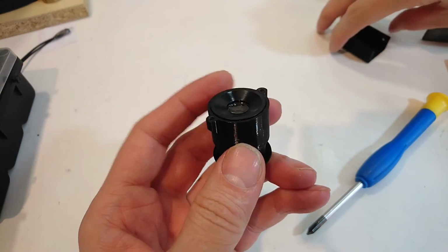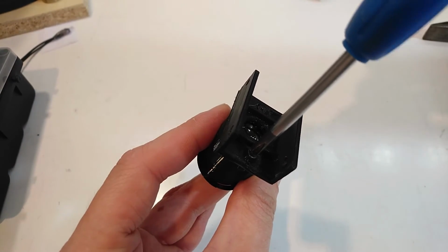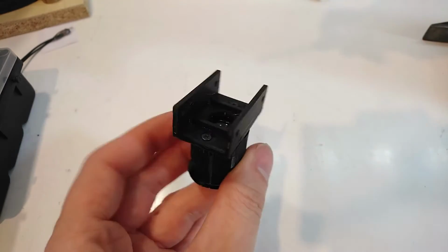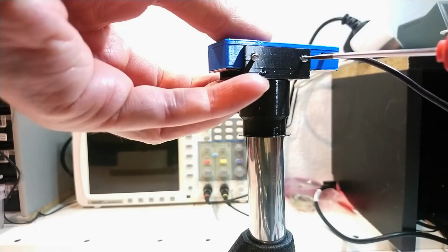On top of the adapter goes the part that holds the camera. It is fixed in place with two screws and has holes in the side for grab screws. I place the camera exactly over the ocular and fix it in place.